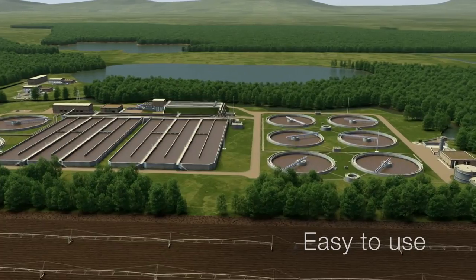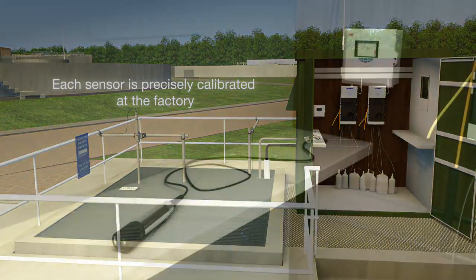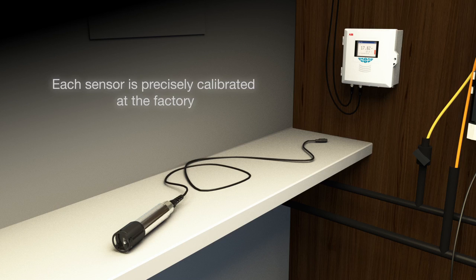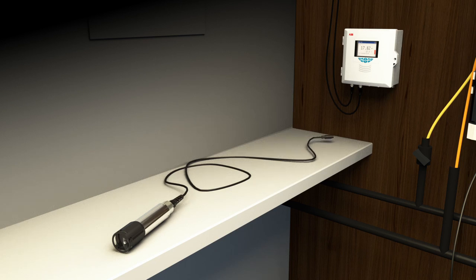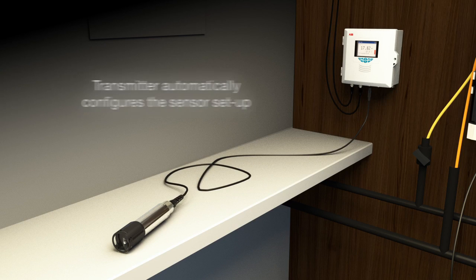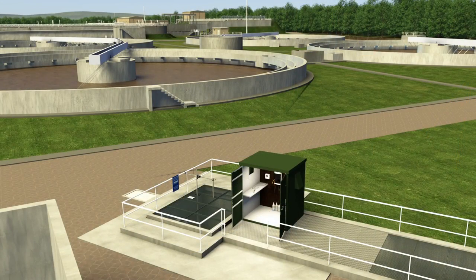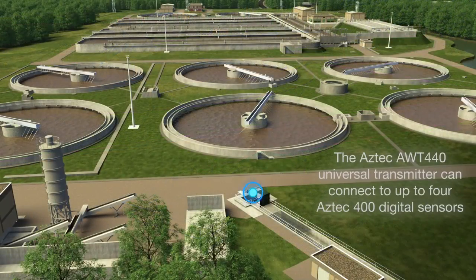Setting up the transmitter and sensor is easy. Each sensor is precisely calibrated at the factory, so it is ready to use straight out of the box. Simply connect the sensor using ABB's EZLink connection, and the transmitter will automatically configure the sensor setup. The Aztec AWT440 universal transmitter can be connected to up to 4 Aztec 400 digital sensors, enabling monitoring at multiple points without purchasing and installing separate transmitters.